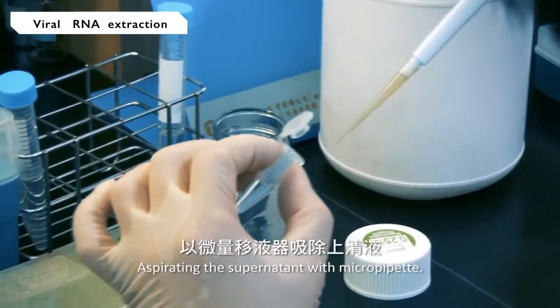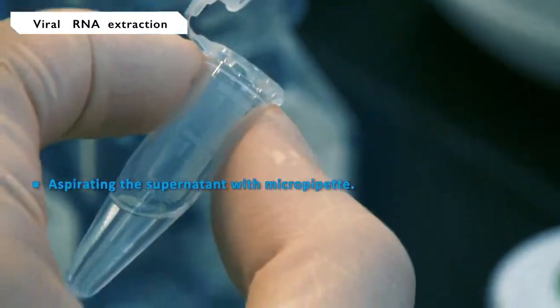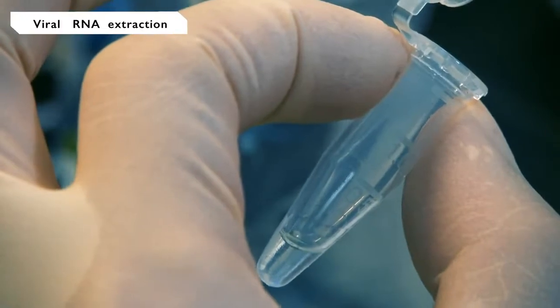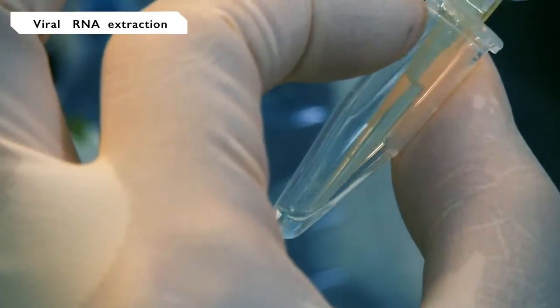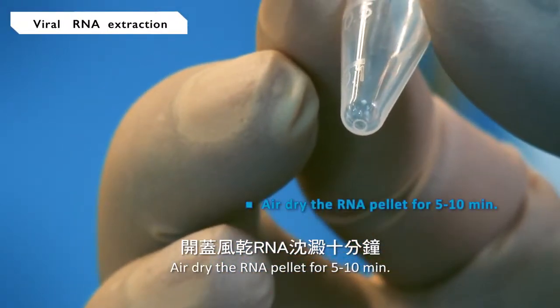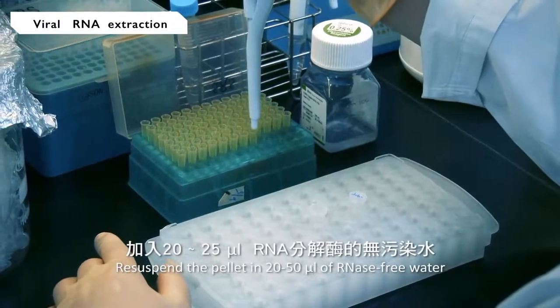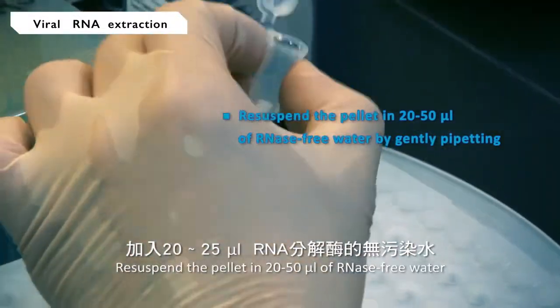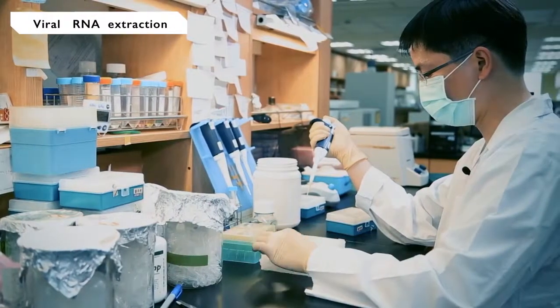Aspirate the supernatant with a micropipette. Air dry the RNA pellet for 5 to 10 minutes. Resuspend the pellet in 20 to 50 microliters of RNase-free water by gently pipetting up and down.